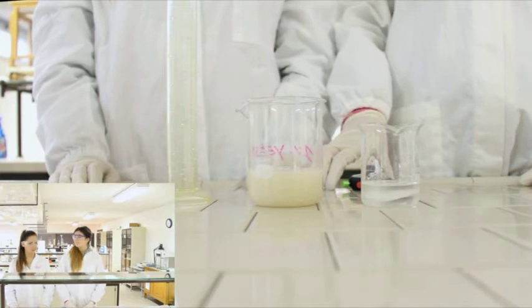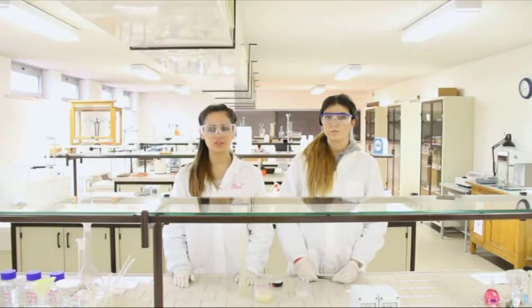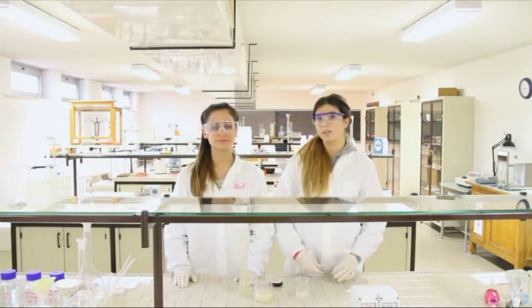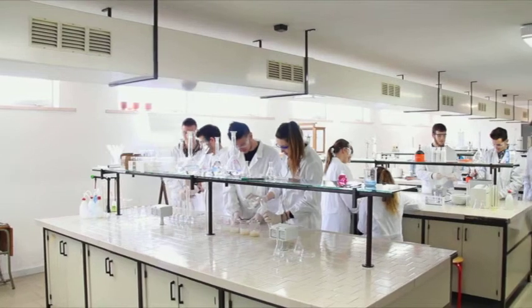Whoa, it's a perfect idea! In this way, we can easily study all the parameters you mentioned before. But we need to perform a lot of reactions. Let's ask some help from my scientist team. I divided our scientists into 3 teams. Let's ask them directly what they are doing and the results obtained.